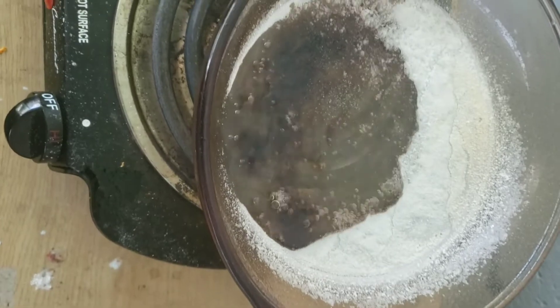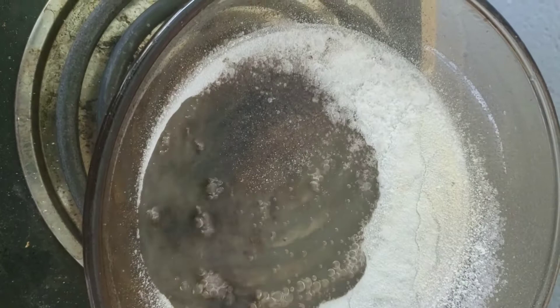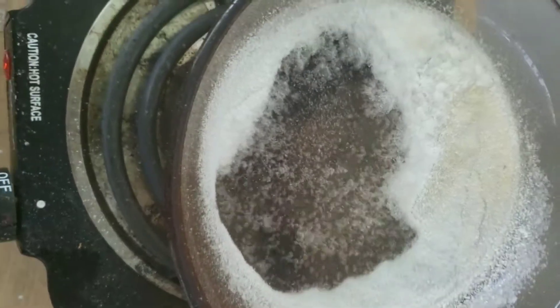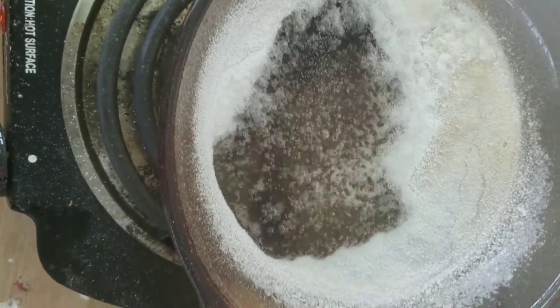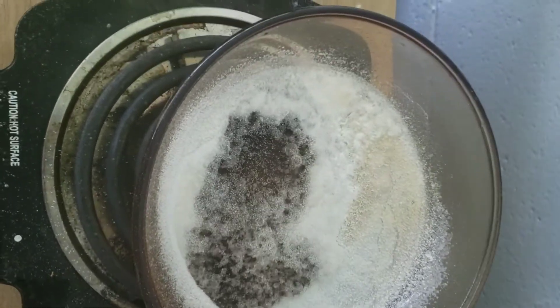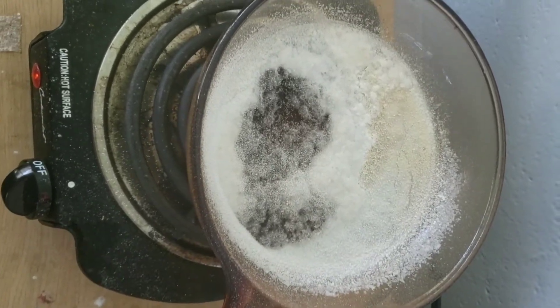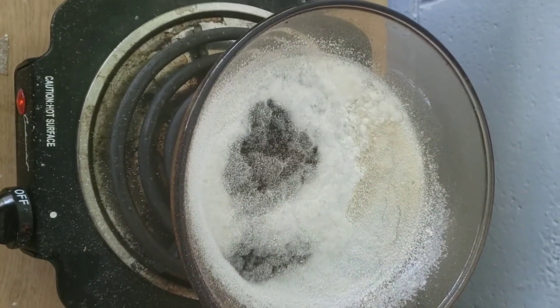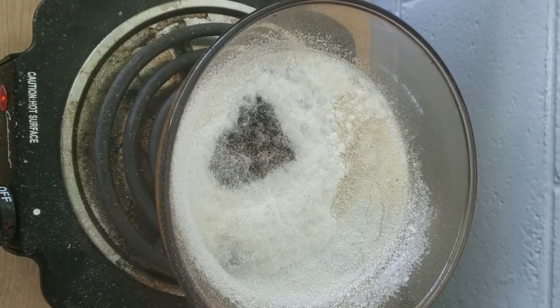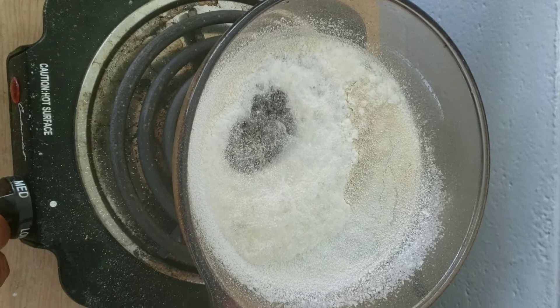I have the image rotated here because I didn't record it the right way, so I turned it so you could better see it. You can see it forming, but you can see at the top that it's getting brown even though I'm trying to hold it off the hot plate. If you do this correctly, you'll have something like this — crystallizing, and not a thick gooey paste.